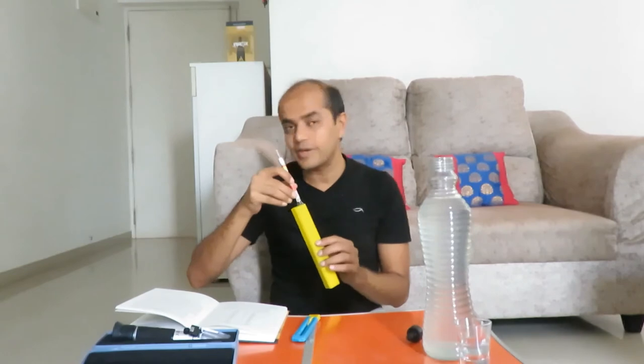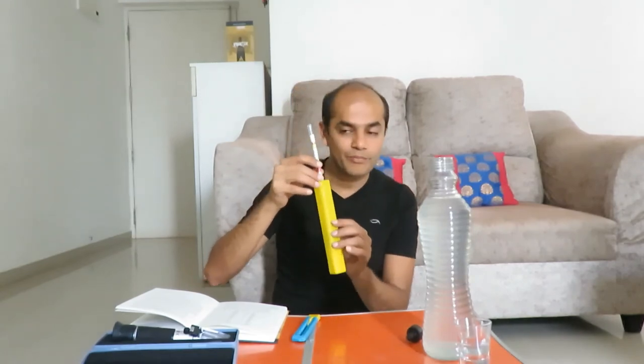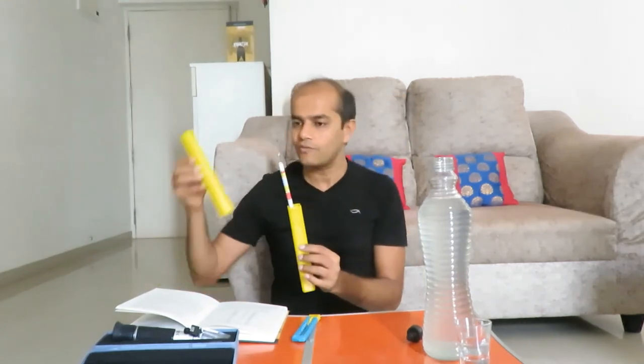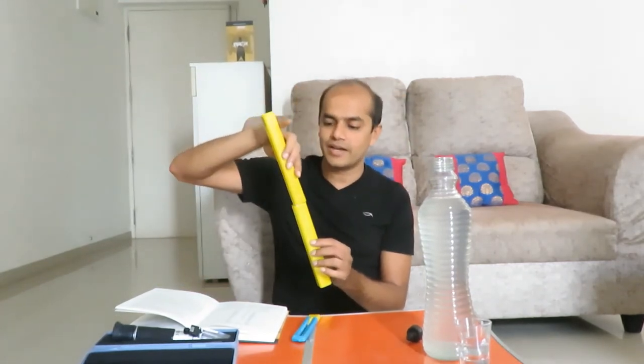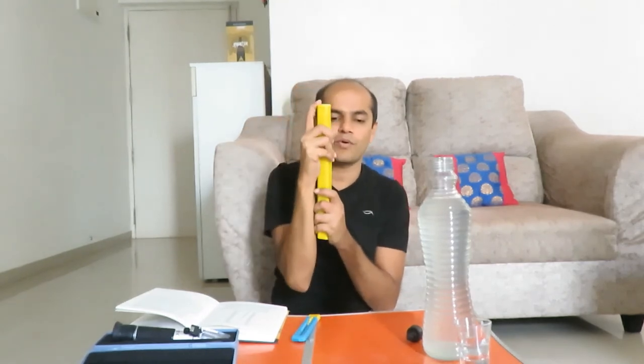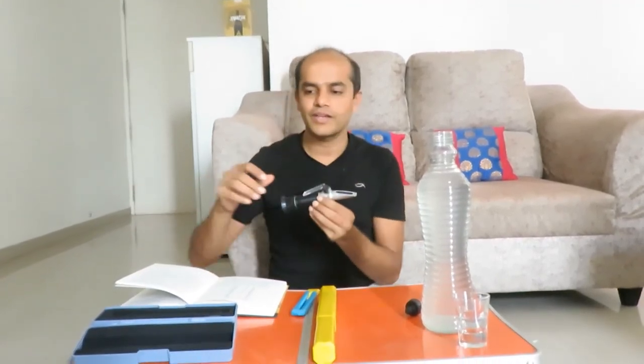You have to be very careful with hydrometers because they are made of glass and, being cylindrical, they tend to roll off surfaces. Always keep them in their rectangular carton and away from children. Make sure they do not roll off your table — I have lost more than a dozen hydrometers that way.